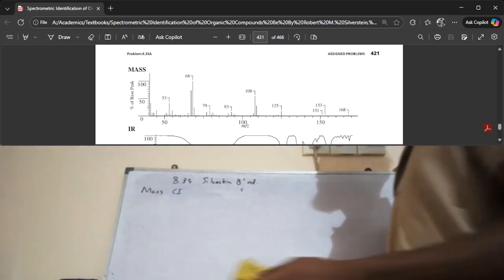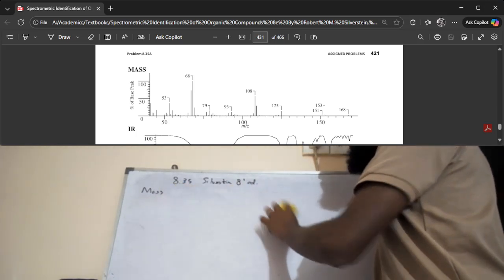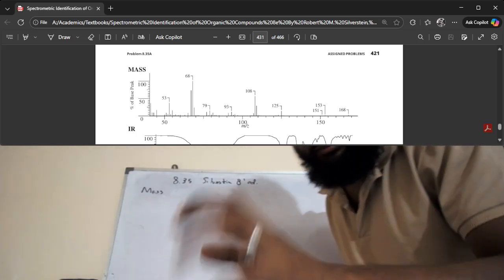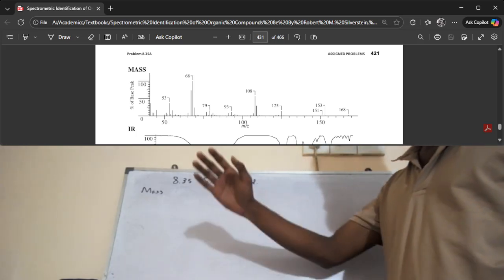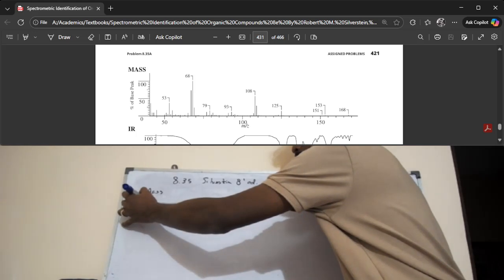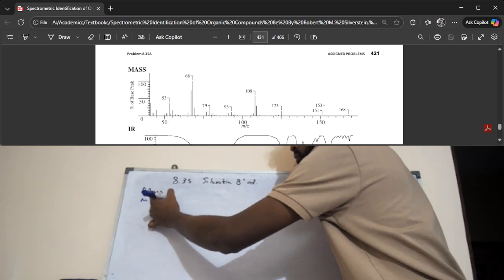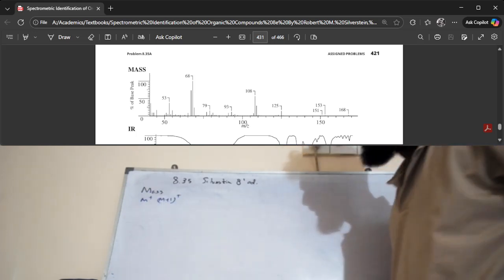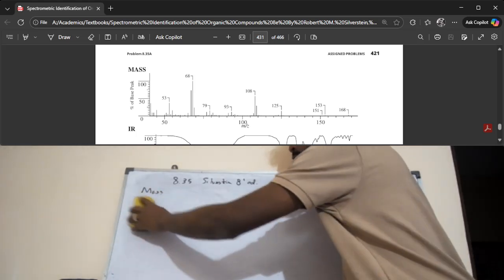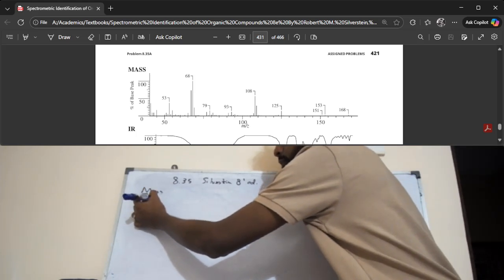All right. In this case, it's electron ionization, and usually in electron ionization, the peak at the highest end, which signifies the molecular ion, is actually the M plus ion. It could also be the M plus one ion as well. So it could be either. However, we will not be too sure. In general, we'll say it's 168.